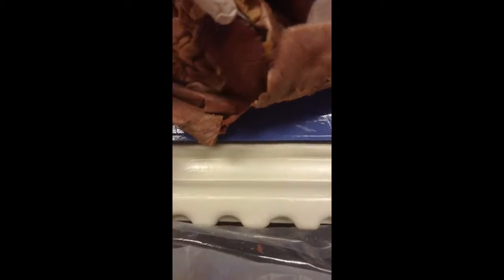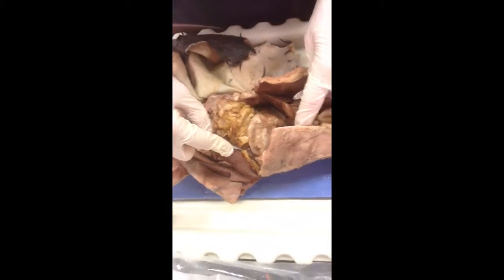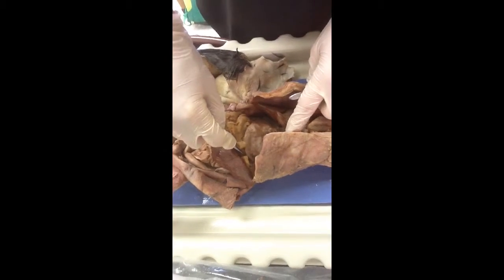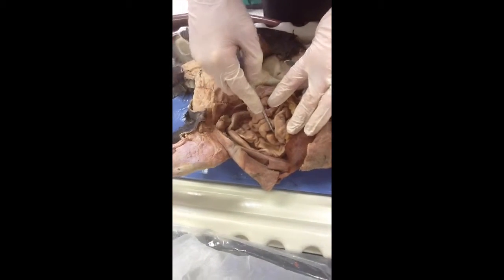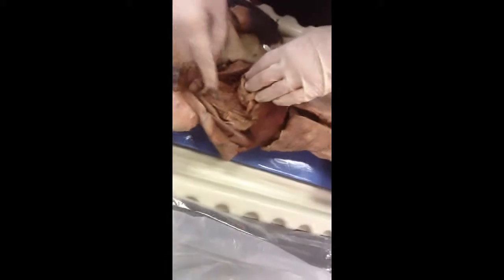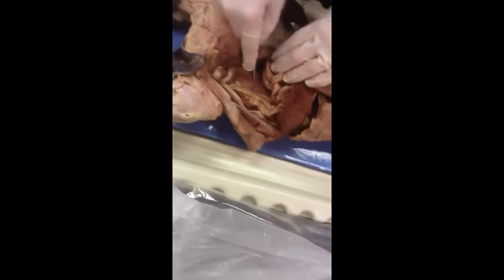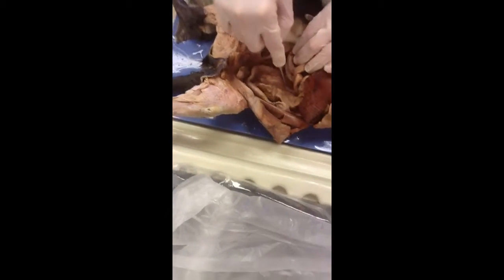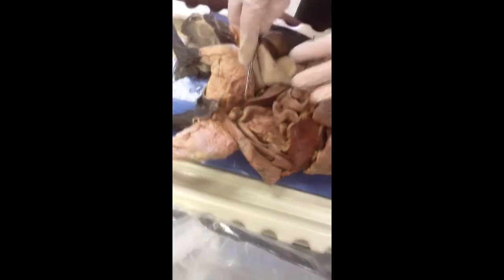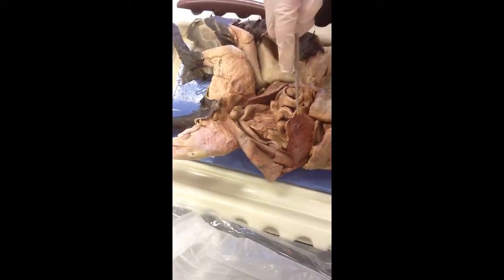The stomach is right somewhere over here. Small intestines right here. The large intestine with the colon and stuff is right here. You can see it goes down that way. And I don't know where the rest is. What's the rest? Gallbladder and pancreas and liver. They're right here. They're in the back.